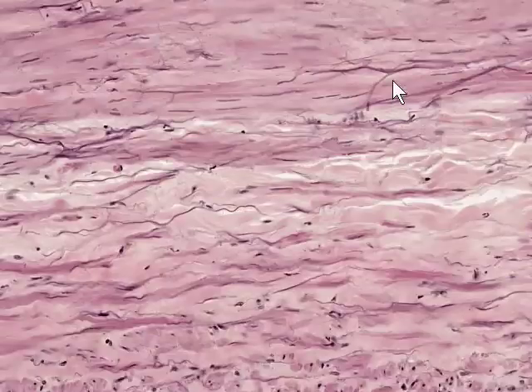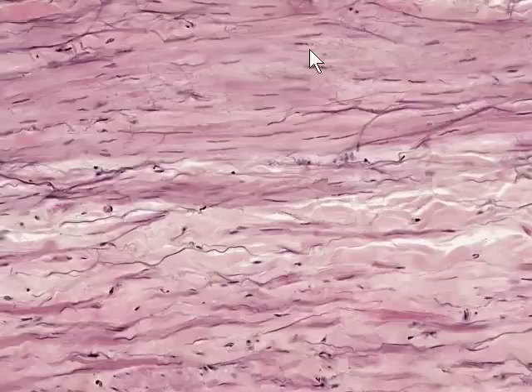As we move to the tunica media, which is going to extend from here out perhaps to about here, or maybe perhaps a little further, what we see is the tunica media looks largely collagenous, dense irregular connective tissue in nature, and interspersed among this collagenous connective tissue are fibroblast nuclei, which we can see here, the elongated ones. There are also some nuclei which may belong to scattered or dispersed smooth muscle cells, this one here for example, and in fact there are scattered and dispersed smooth muscle cells found in the tunica media, but they're not terribly well organized and there aren't too many of them.